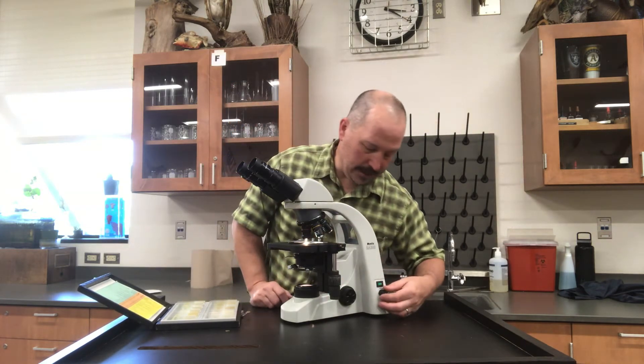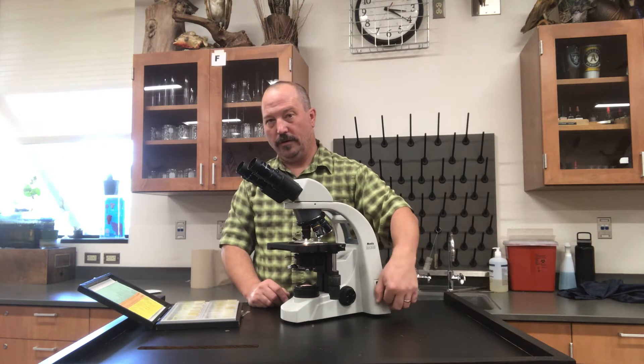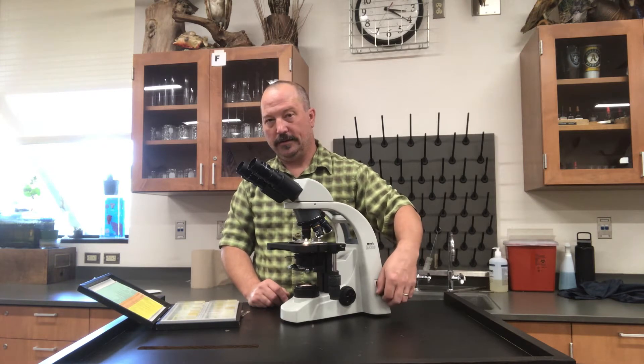Adjust the amount of light — you can see the intensity of the light goes more or less right there. People always ask how much light do I need to see something. That's entirely up to you. The whole point of the light microscope is it has many different ways you can adjust the light so you can properly see whatever's under there. It just takes trial and error.